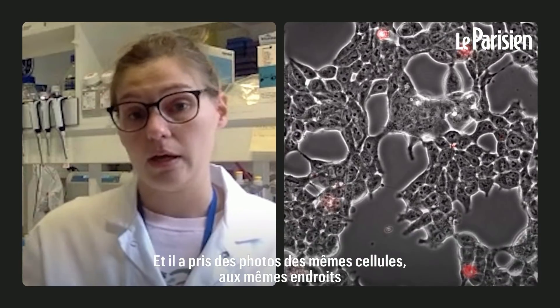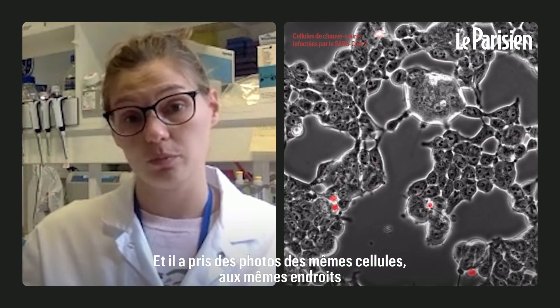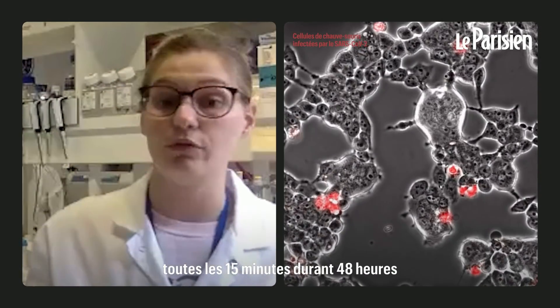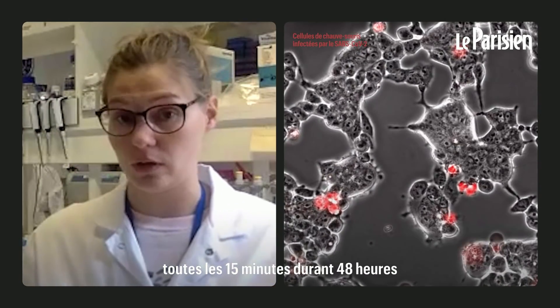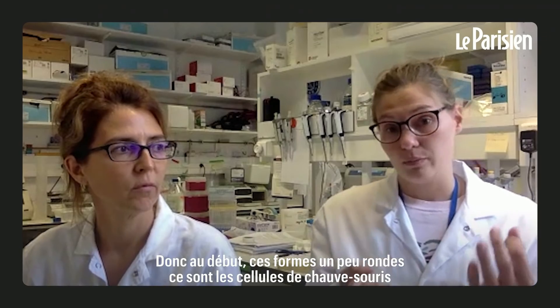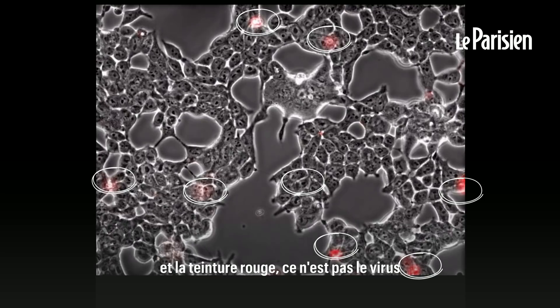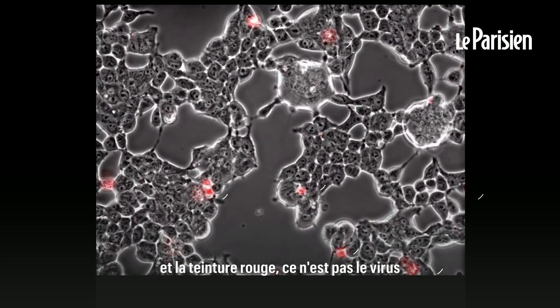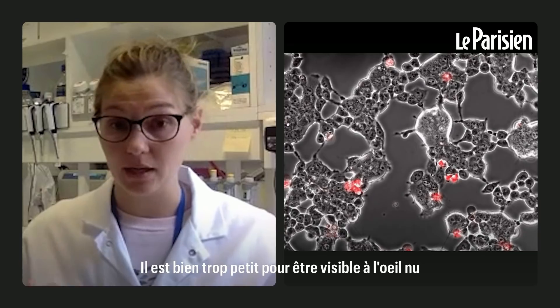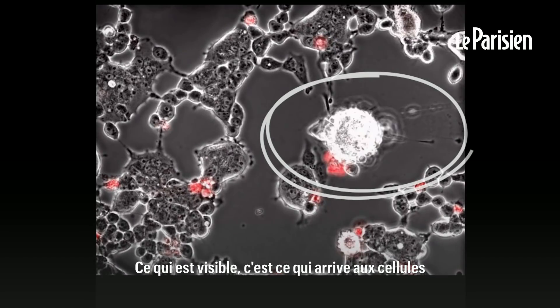This microscope takes a picture of the same cell at the same spot every 15 minutes over the time course of 48 hours in our case. At the beginning, those roundy shapes are the cells. The red stain is not the virus — the virus is way too small to be visible by eye. What is visible is what happens to the cells.